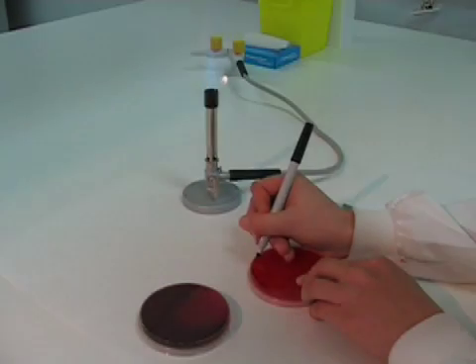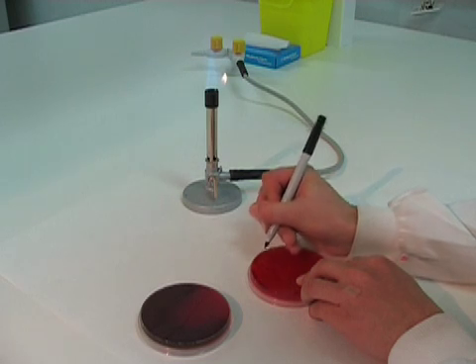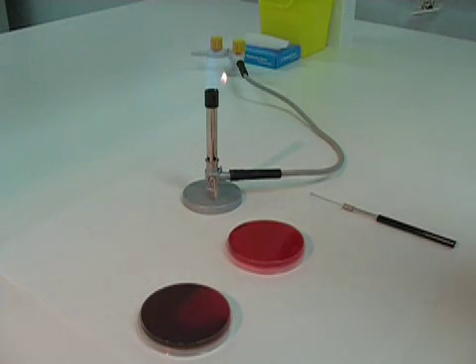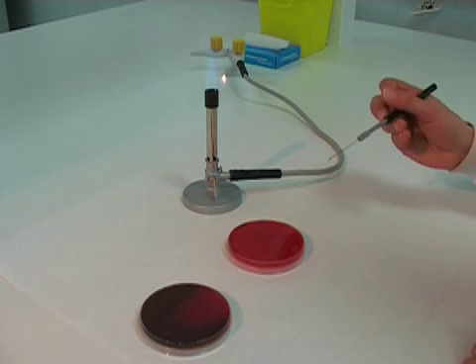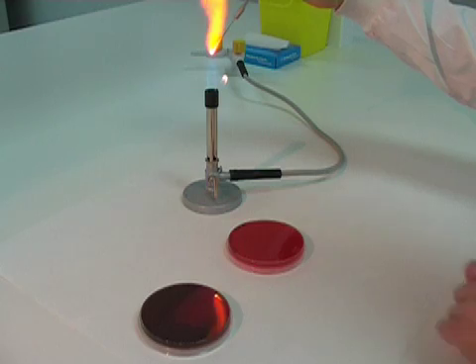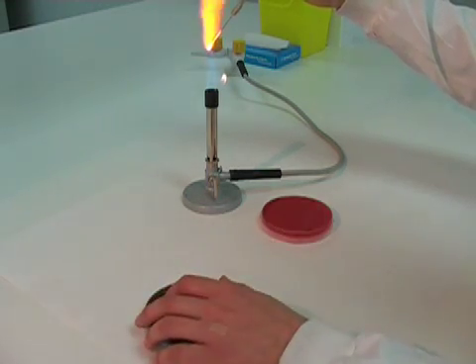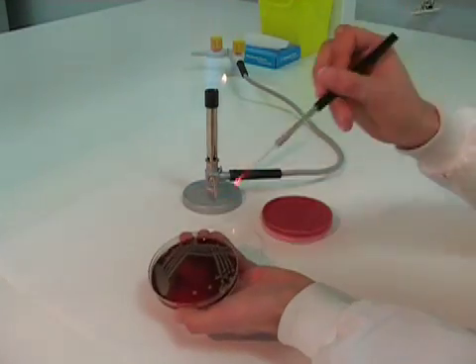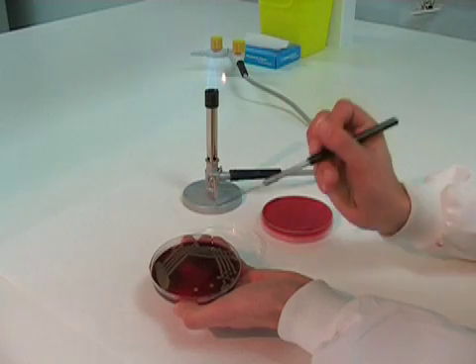Now for a demonstration of the plate being streaked. Notice, to keep the plate sterile, it is streaked close to the Bunsen underneath the flame. To make the sets of lines easier to streak, the plate is rotated between each set.